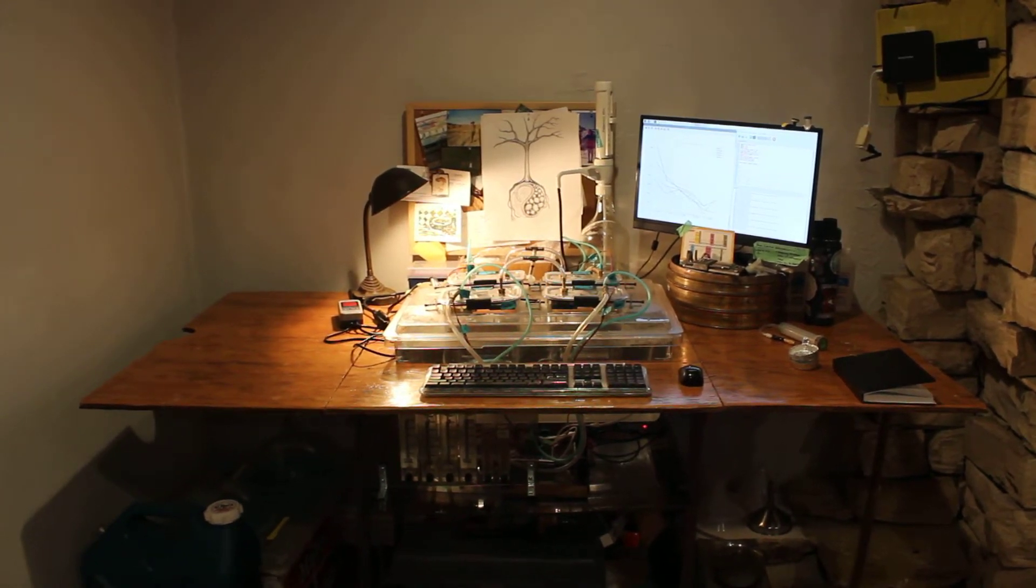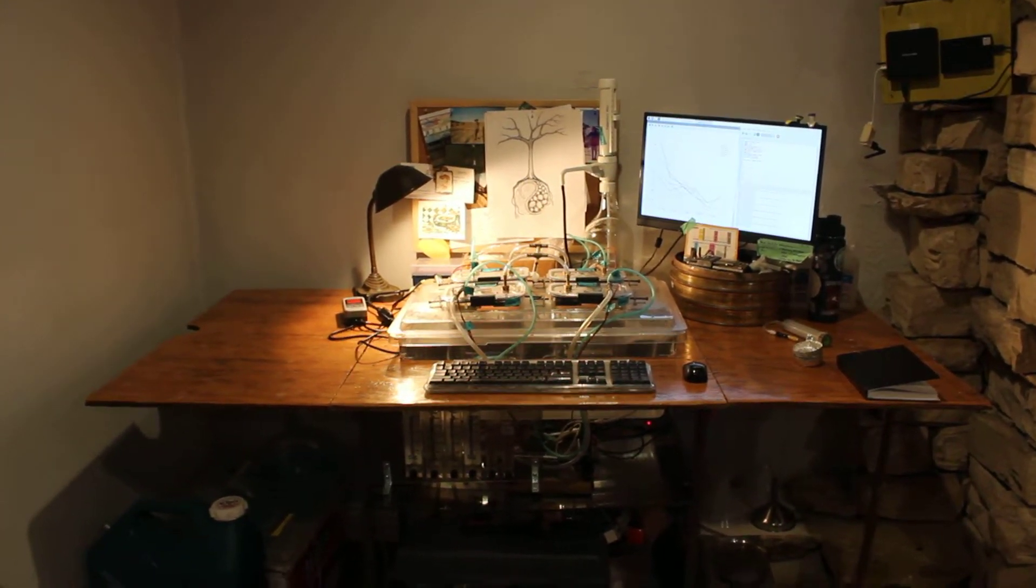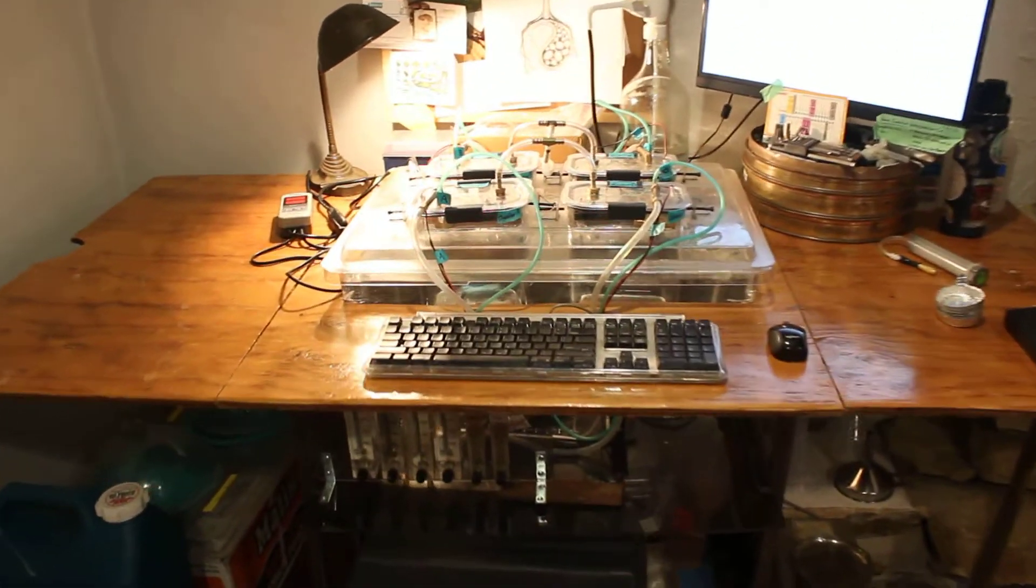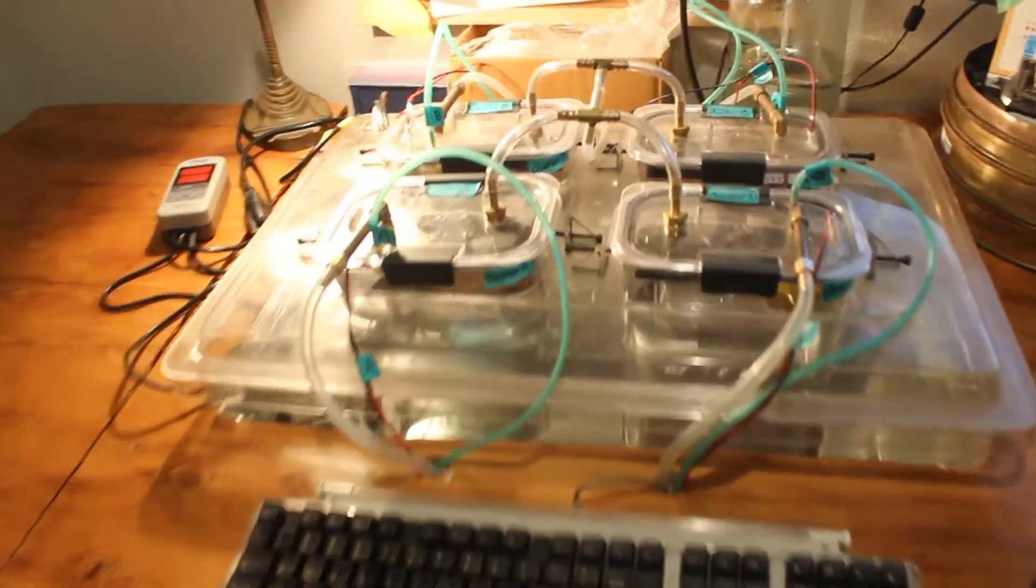Hey guys, so the soil water bath incubator is finally up and running and it's working. So here it is.